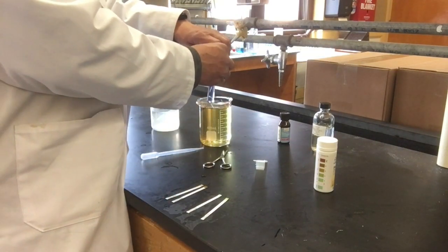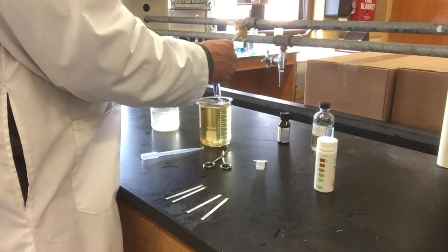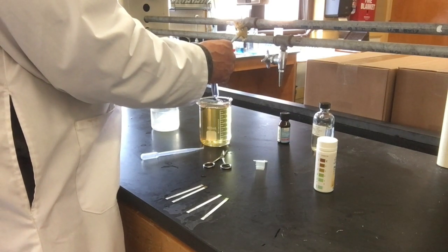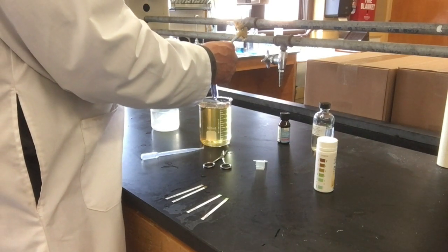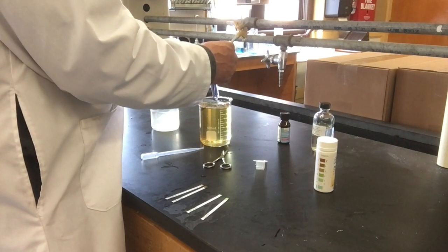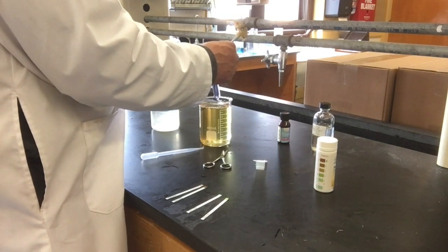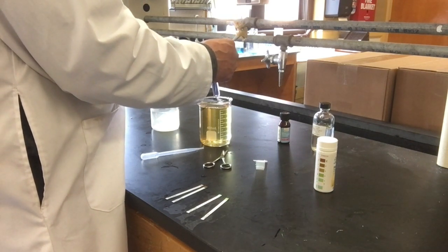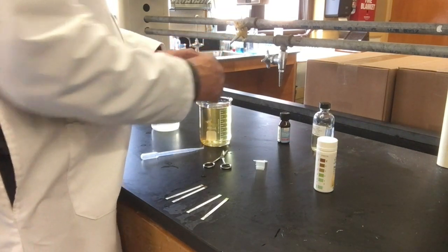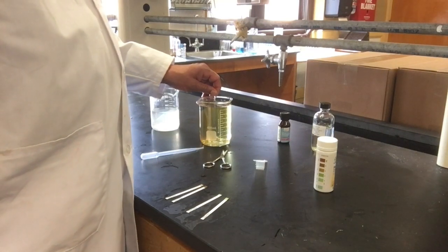At the beginning, the beaker tested positive for iodine, and the bag tested positive for glucose with starch inside. At the end, the bag still tested positive for glucose but also for iodine due to the blue color. That concludes the dialysis diffusion lab.